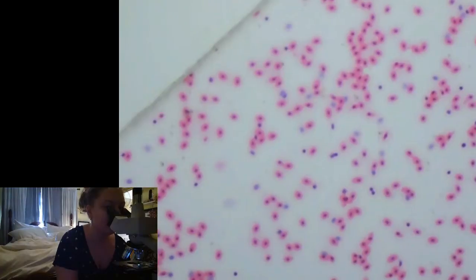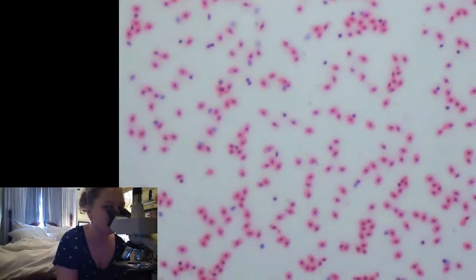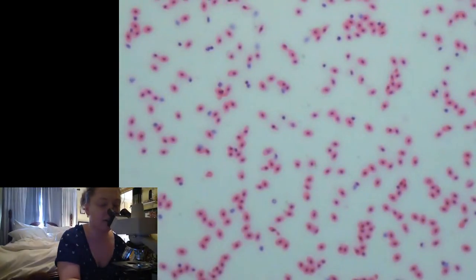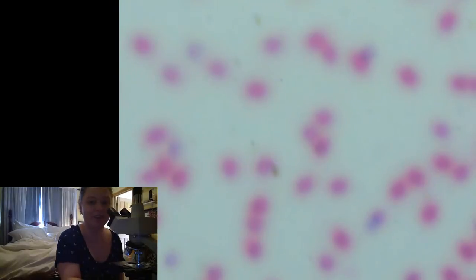So I've got frog blood first. All right, there it is. So pull it up over there. And then we get it a little closer. Oh yeah, that's cool.